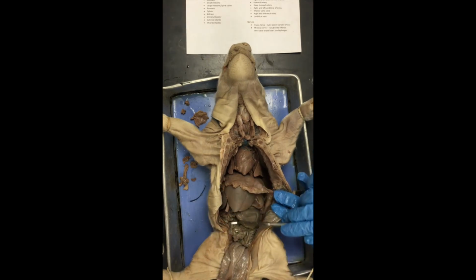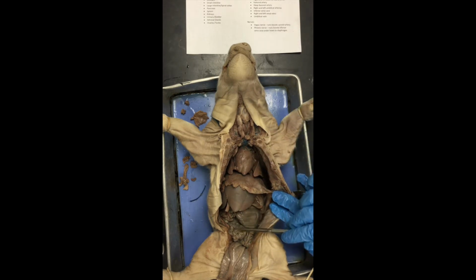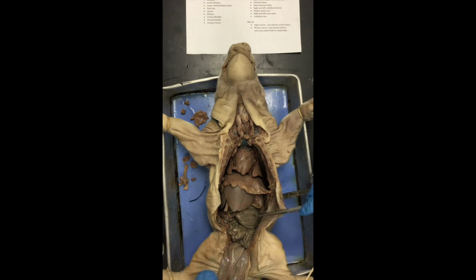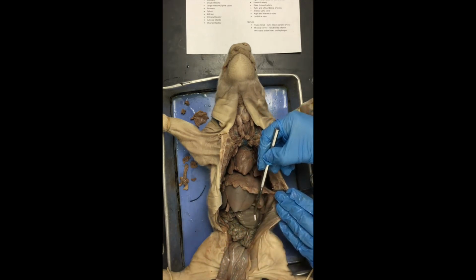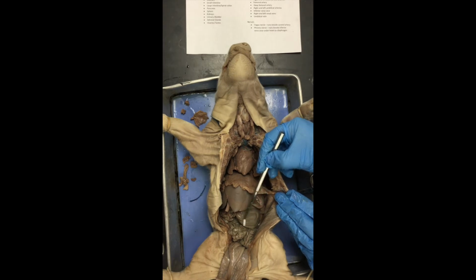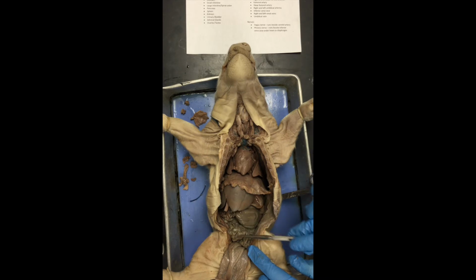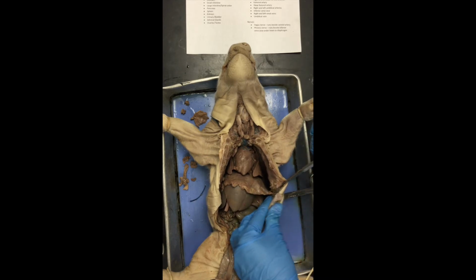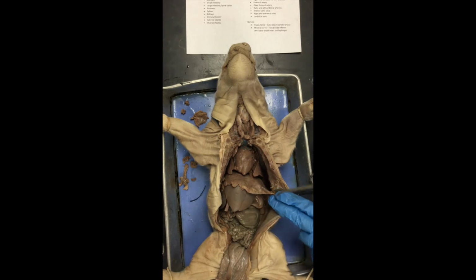So this is parietal peritoneum. The visceral peritoneum covers the surface of the abdominal organs, and it's very similar to that pleura up here. You can't really see it, you can't really peel it off because it is part of the organ itself, but it's what gives the organ this shiny appearance. So visceral peritoneum is on the surface of these abdominal organs that we see, and parietal peritoneum is this membrane that's out here to the side, okay?